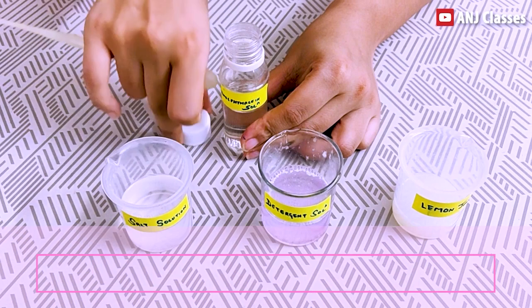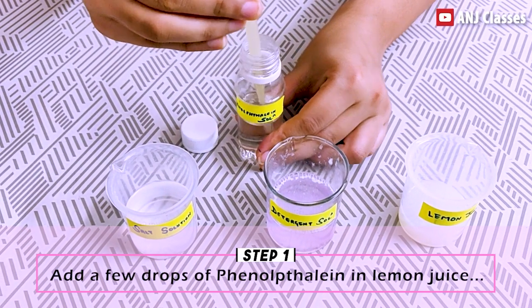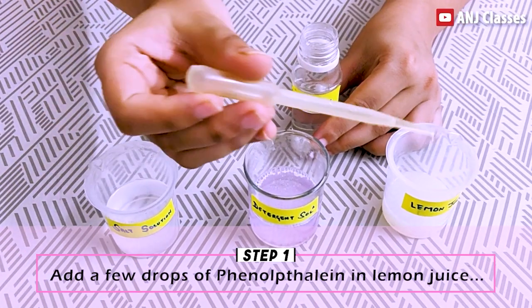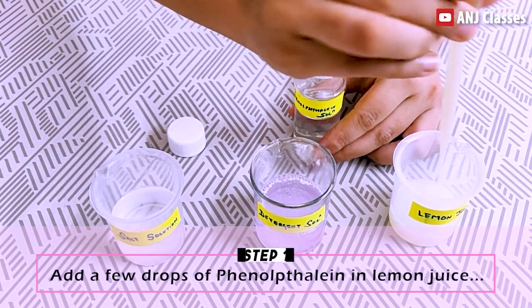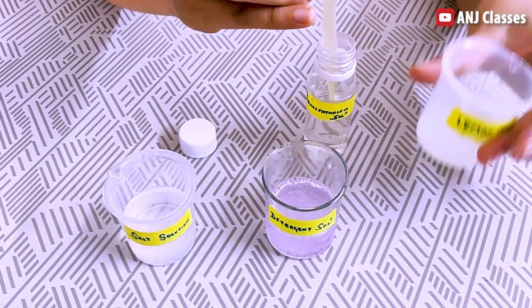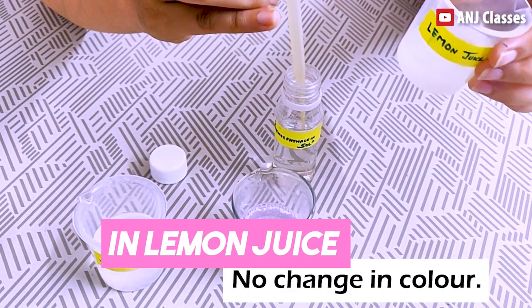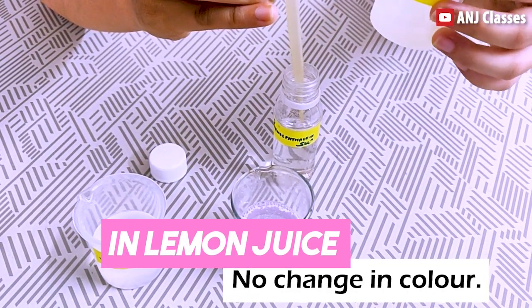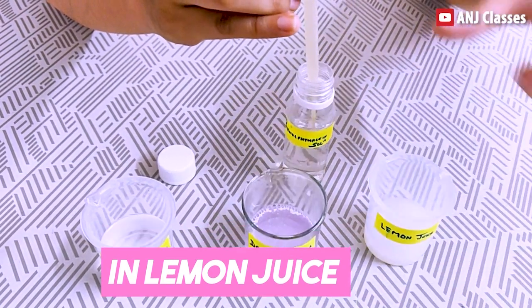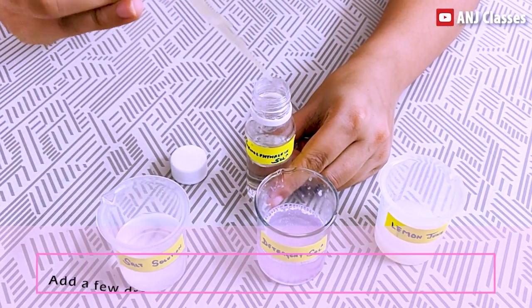First, I will pour few drops of phenolphthalein indicator into my acidic solution, that is lemon juice. You can see there is no change in color when I added phenolphthalein solution to lemon juice, which is an acidic solution.